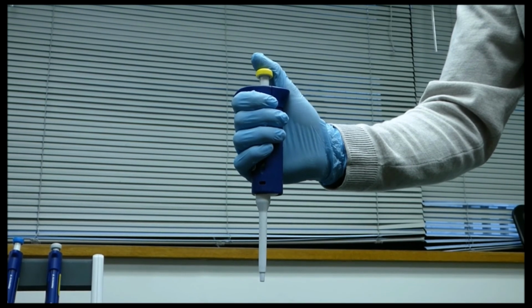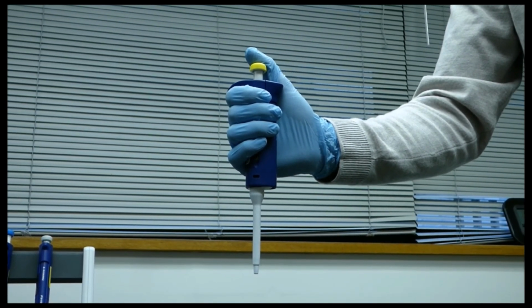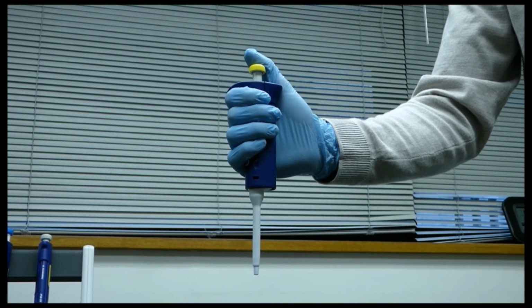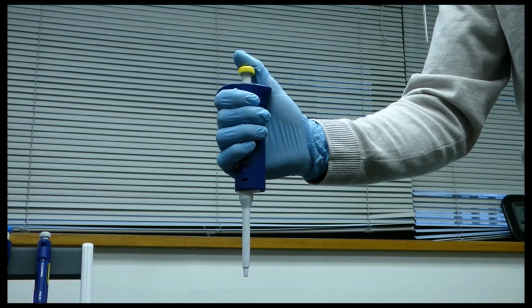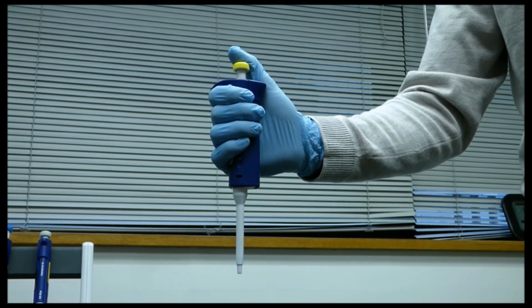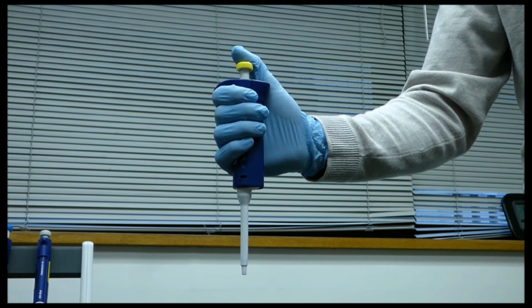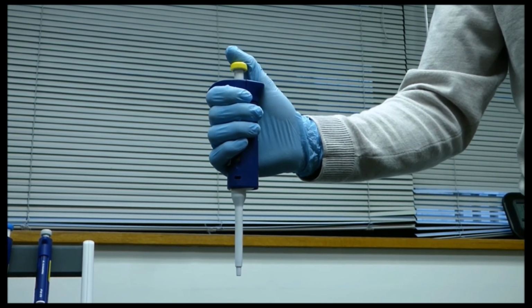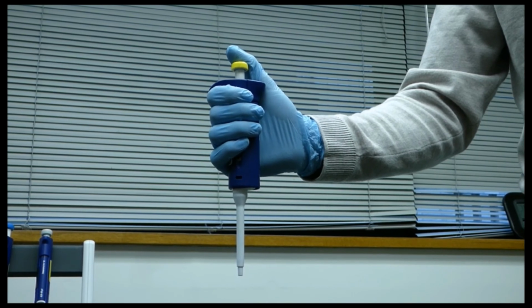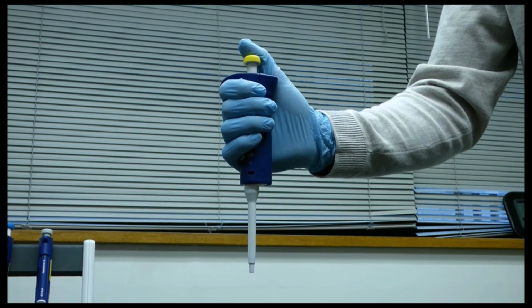Feel free to practice again with a new pipette tip and be sure to understand the series of steps. Try and perhaps pipette different quantities of materials. Understanding how to use a micropipetter is one of the first steps in mastering methodologies in scientific experimentation. In addition, it allows us as researchers to transfer small, accurate quantities of materials from one location to another. Relax, think about the steps, see the beauty of it, and good luck.